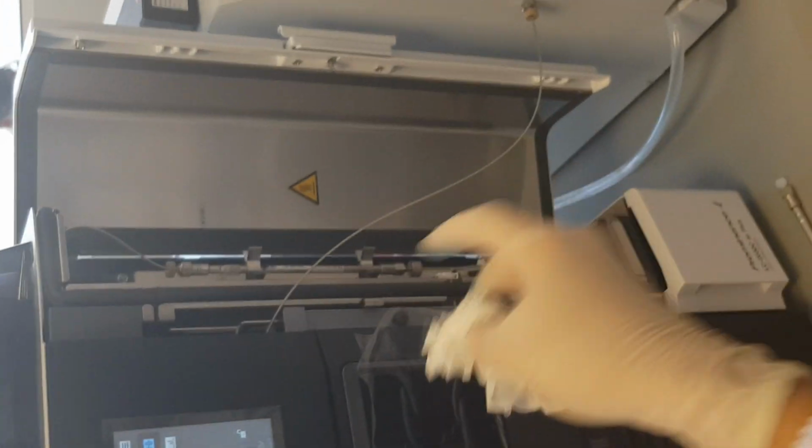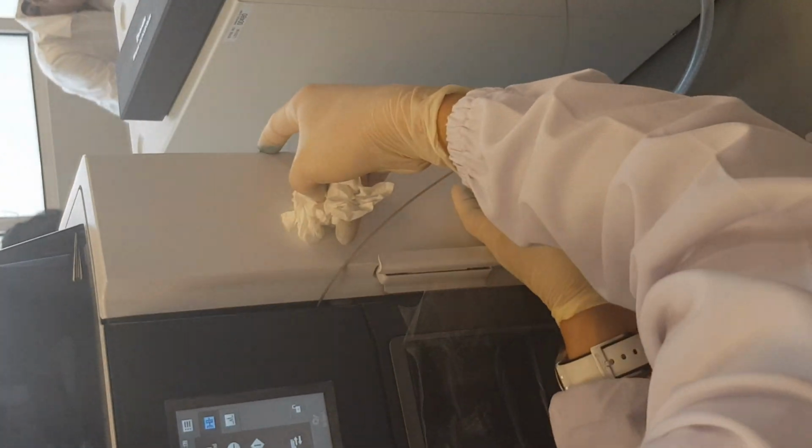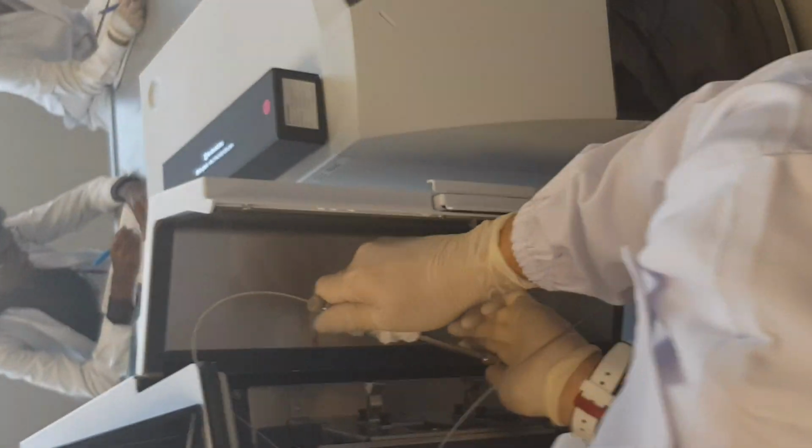Clear? No leakage, stop the pump and you can use it already. Understand? You can close the outlet and use it. Clear or not? Okay, but I want to use back my own column.